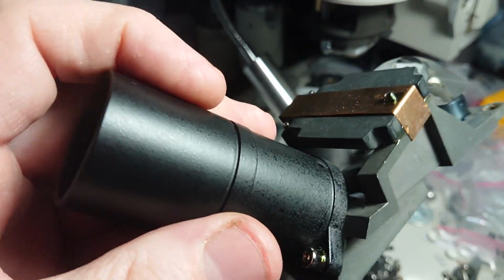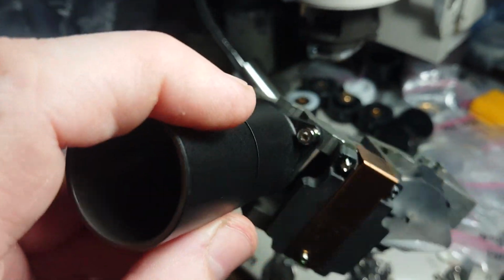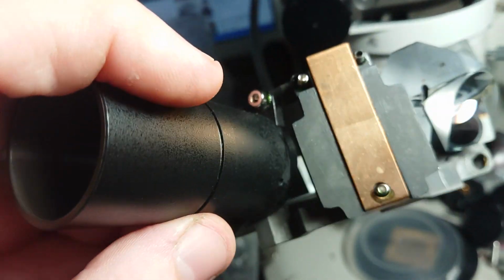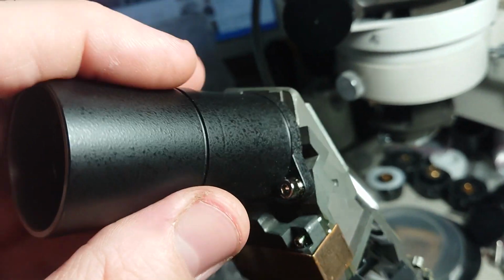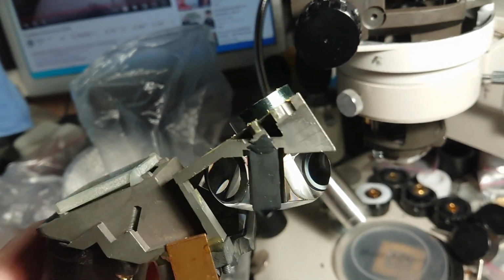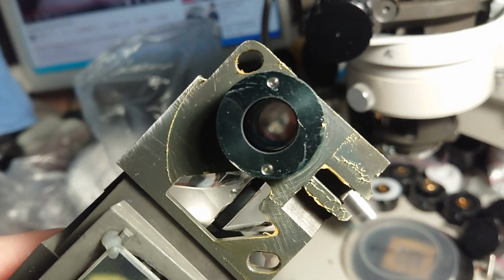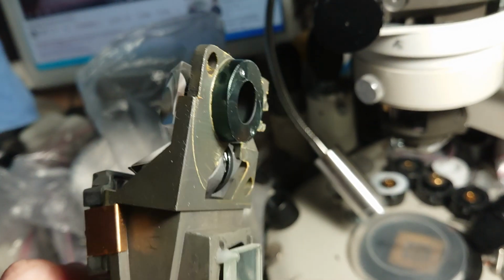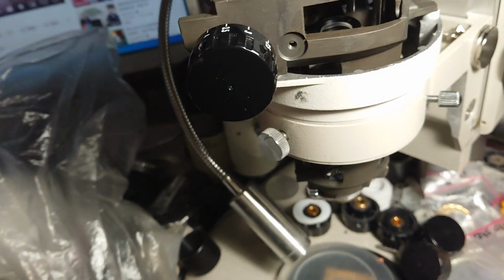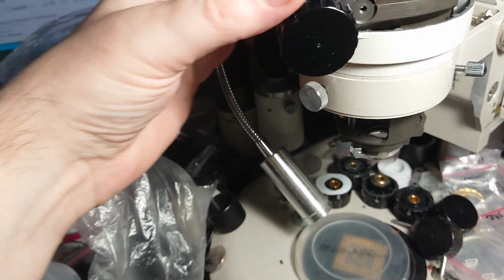And our eyepiece tube, with the protecting glass removed, is attached with only two bolts instead of three as in the Olympus SZ61. So we would say the technical way of design is a bit different, but that is still a pretty nice and contrasty thing.